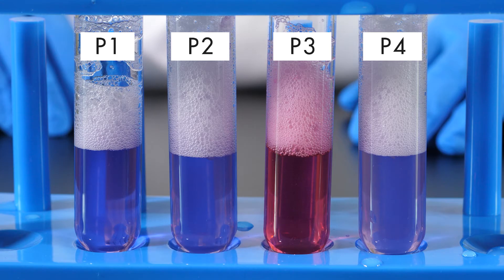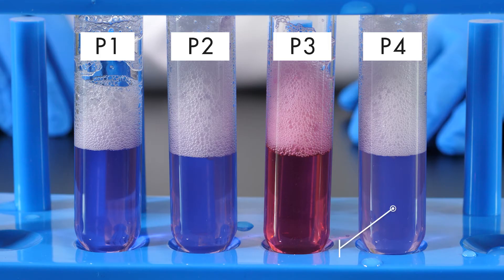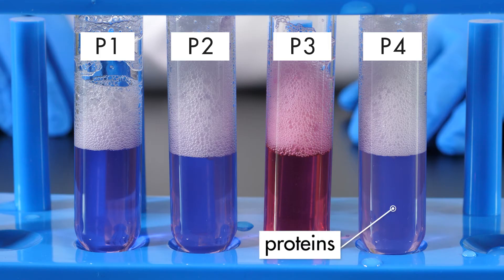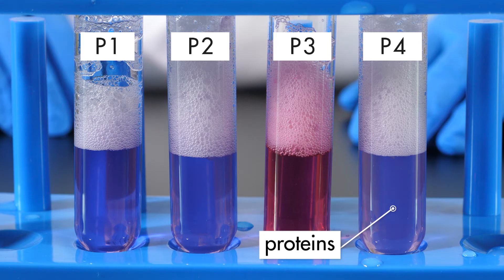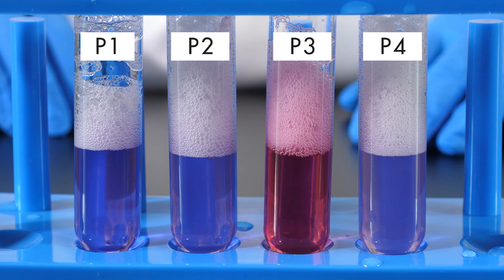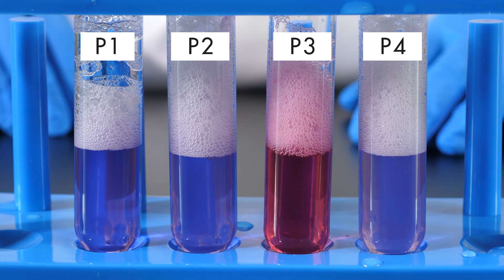Test tube P4 contains albumin and water. The solution in this test tube also turned purple, indicating that proteins are still present in the solution. Protein digestion did not take place. This was the expected result, since test tube P4 was the control.